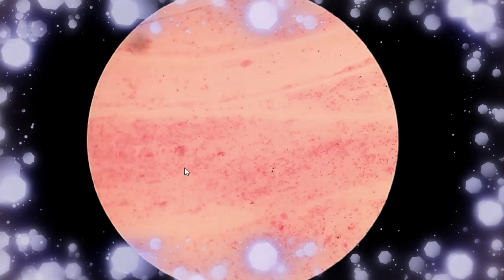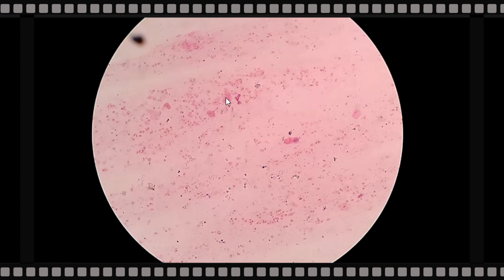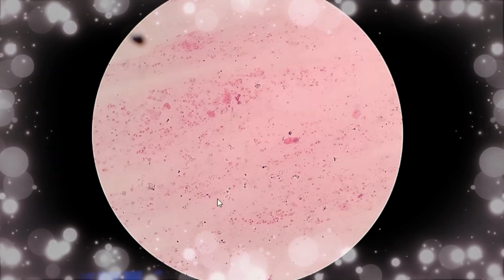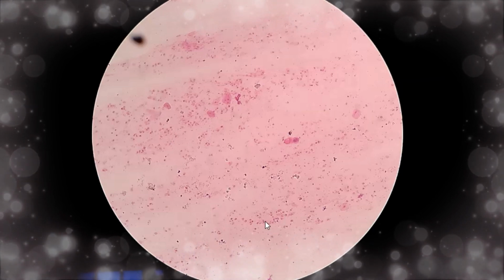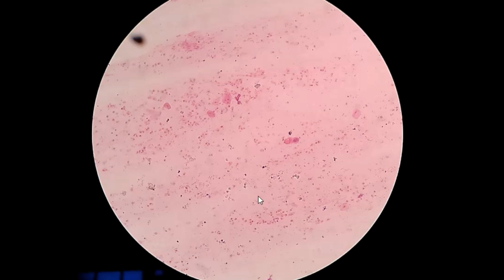An acceptable criteria: if pus cells are greater than 25 and epithelial cells are less than 10 at low power, then the sputum specimen will be accepted for culturing.